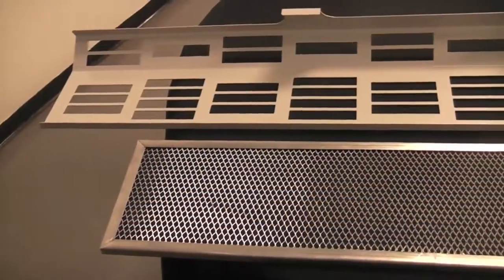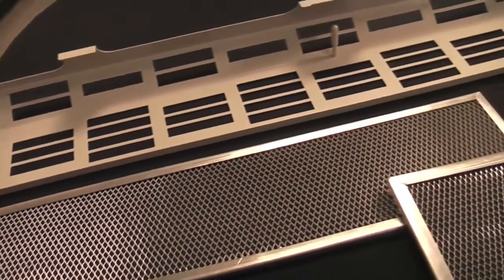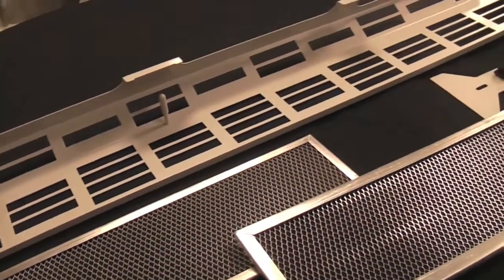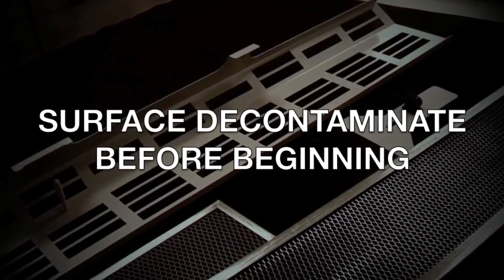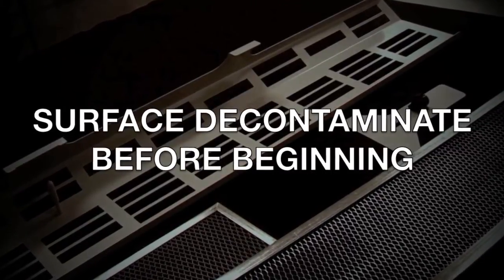This video will demonstrate how to install the pre-filter kit for LabConco's Logic Series Class II Biological Safety Cabinet. Before performing any of these activities, be sure that the inside of your cabinet has been cleaned by surface decontamination.